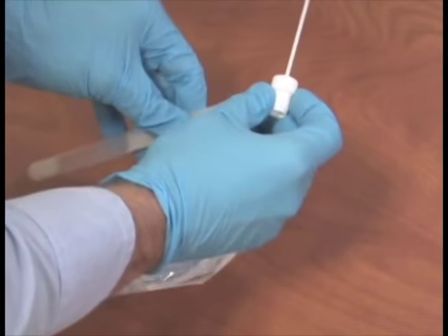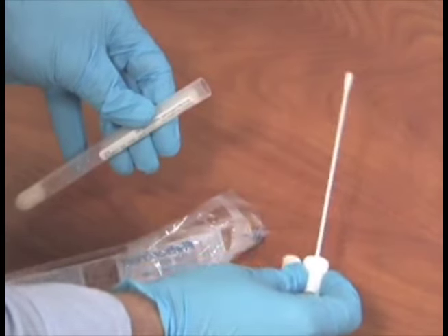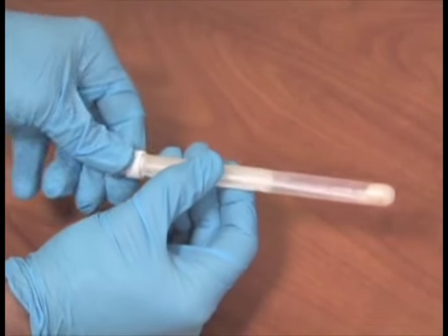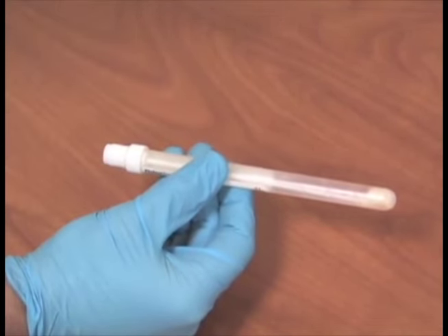Five, remove the cap from the swab case and discard. Six, carefully insert the swab into the case, making sure to seat the cap firmly on the case and that the swab end is touching the media-soaked sponge at the bottom.